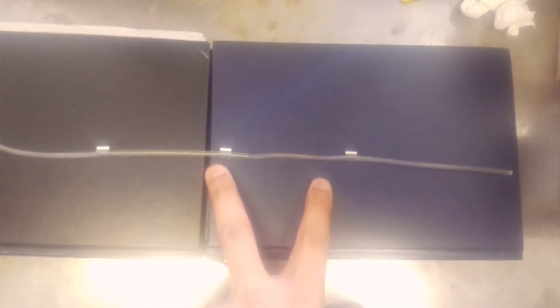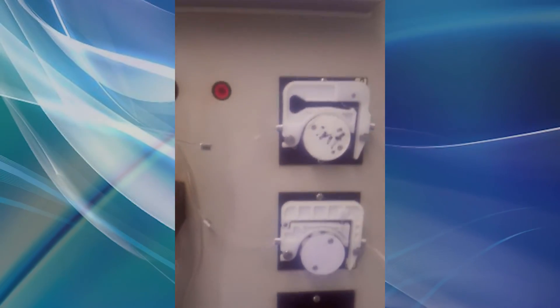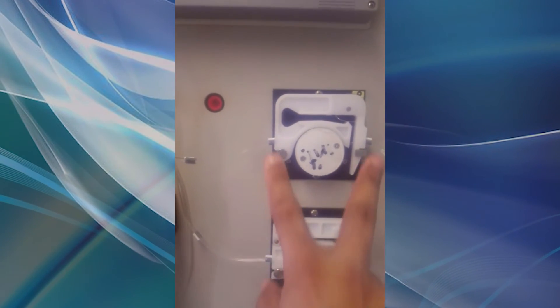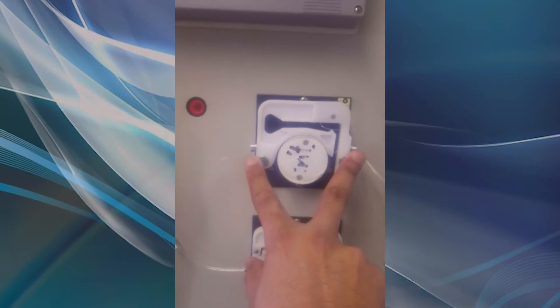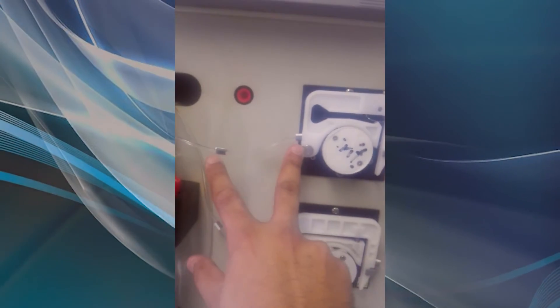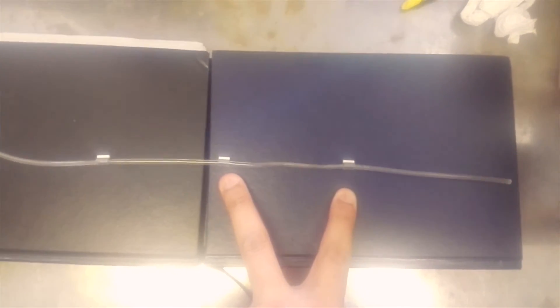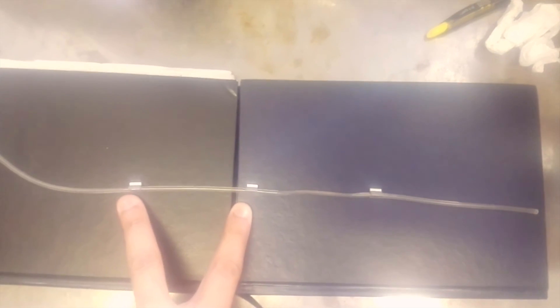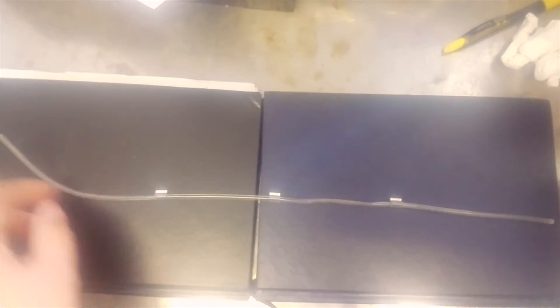I will show this tube. This is a Tygon grey-grey tube. This tube has two sections, and we can use this tube two times. The life of one section is four weeks. After four weeks, change the section of the tube, and after eight weeks or approximately two months, you need to change the complete tube. Now we see what is on the backside of this panel.